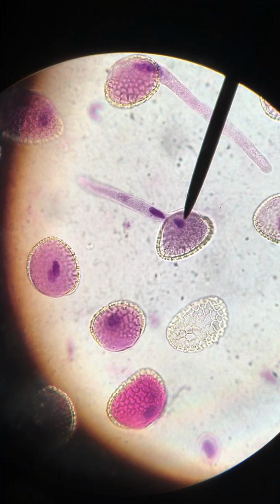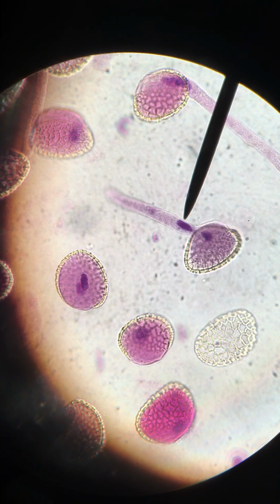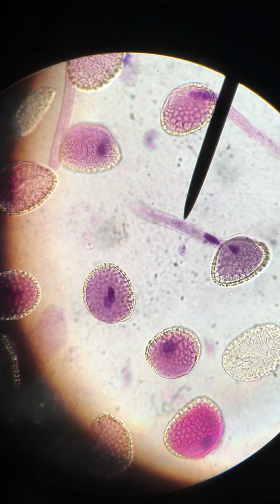But I was about to say that you can also see on this example, which is lovely, that a sperm, and perhaps two, are visible in this pollen tube. So if you have read over the lab manual already, you might have noticed that it said that there are 2 sperm that will be released after this pollen tube grows down the stigma, style, and enters into the ovary of the female reproductive parts.